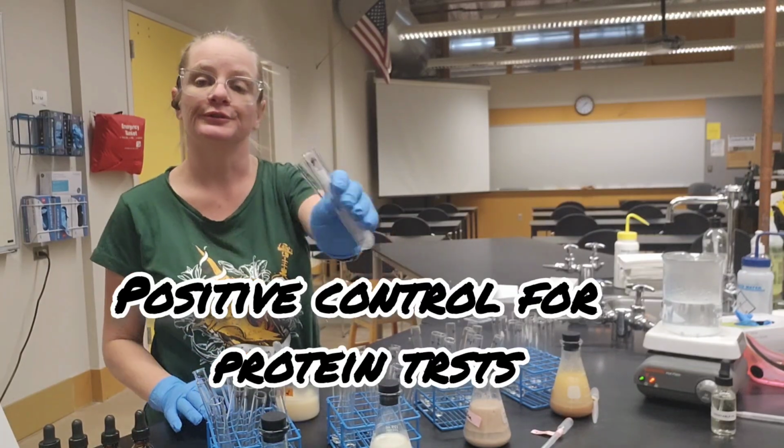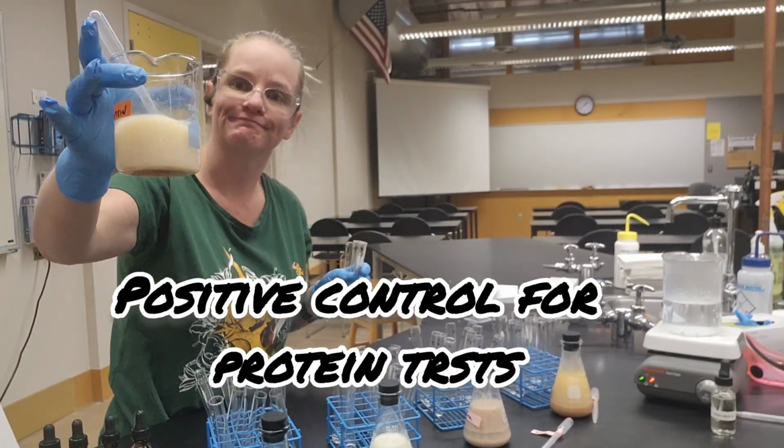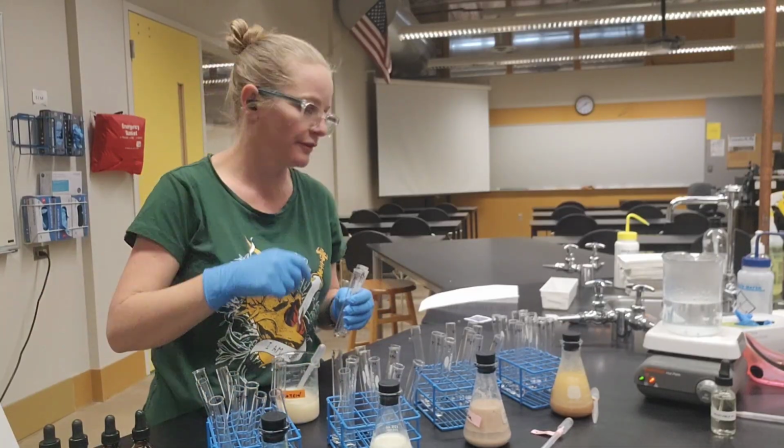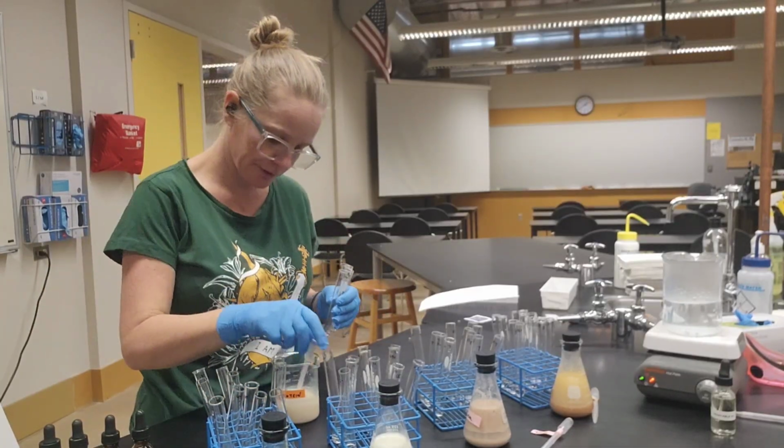We are going to use muscle milk. Okay, this is just protein powder that you would get at a health food store, the thing that the scoop that you put in your shake in the morning.